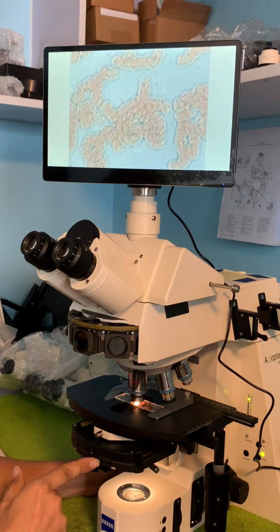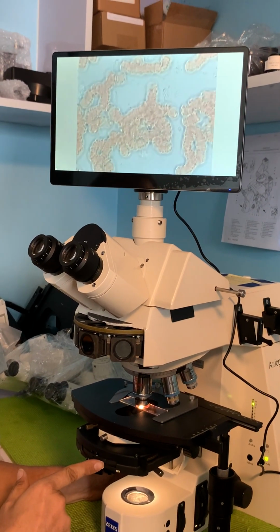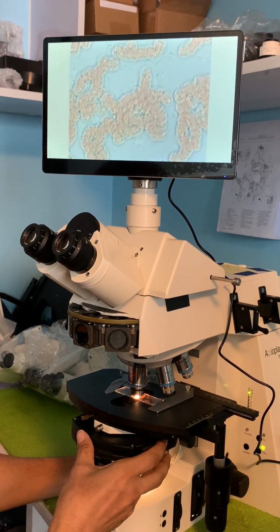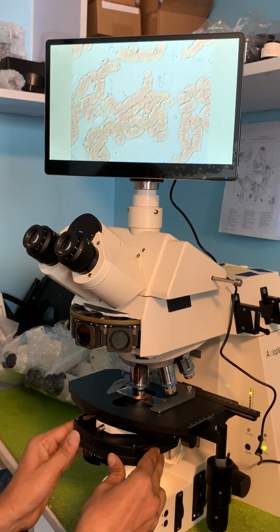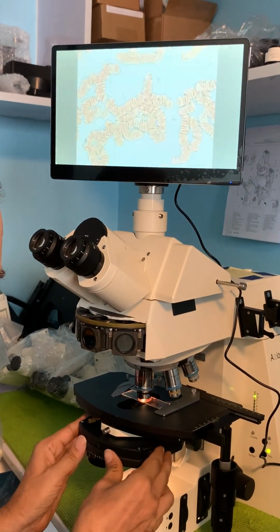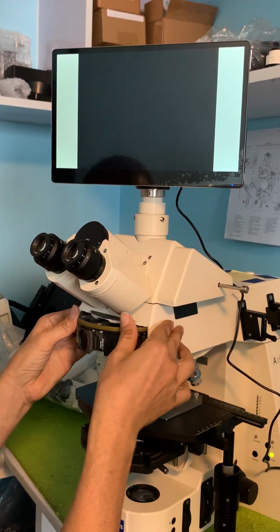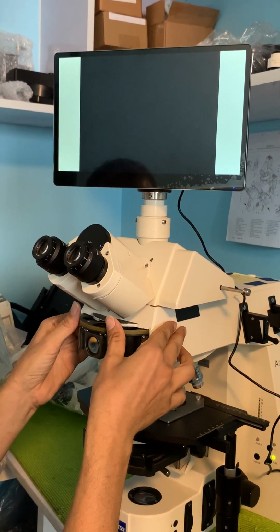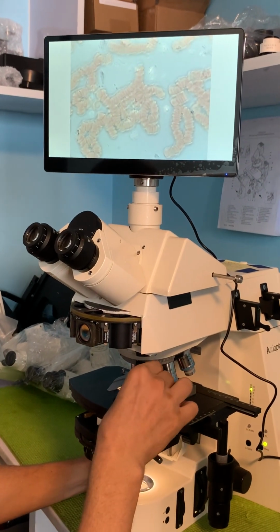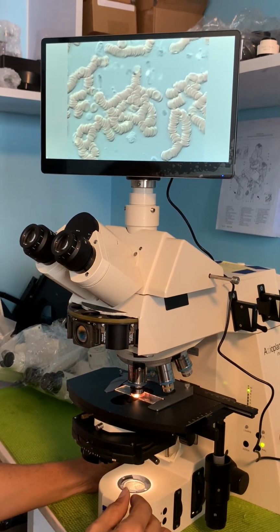If we wanted to do Darkfield and get some good images, what we would want to do is to take off this condenser and put on a dedicated Darkfield oil condenser. So let's take it back off of the Darkfield, and let's go over to our DIC again. And we're going to put in our prism. There's the DIC once again.